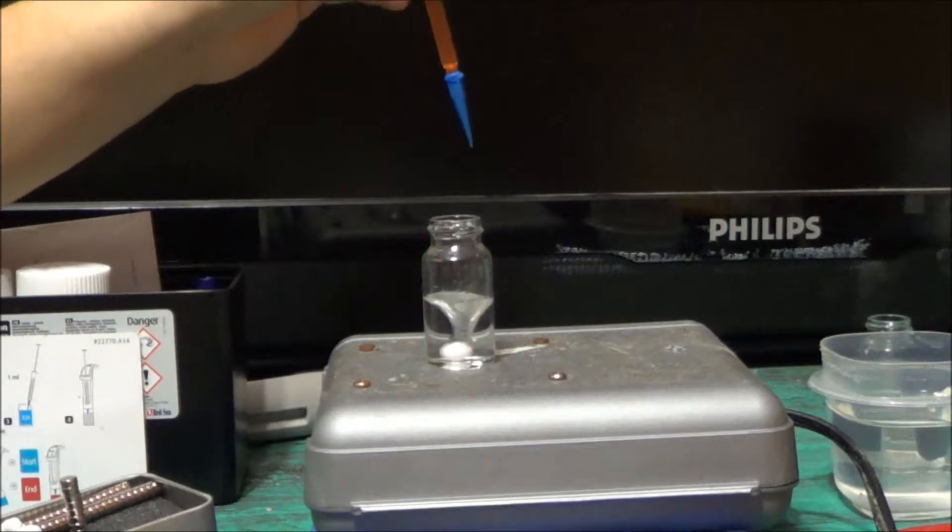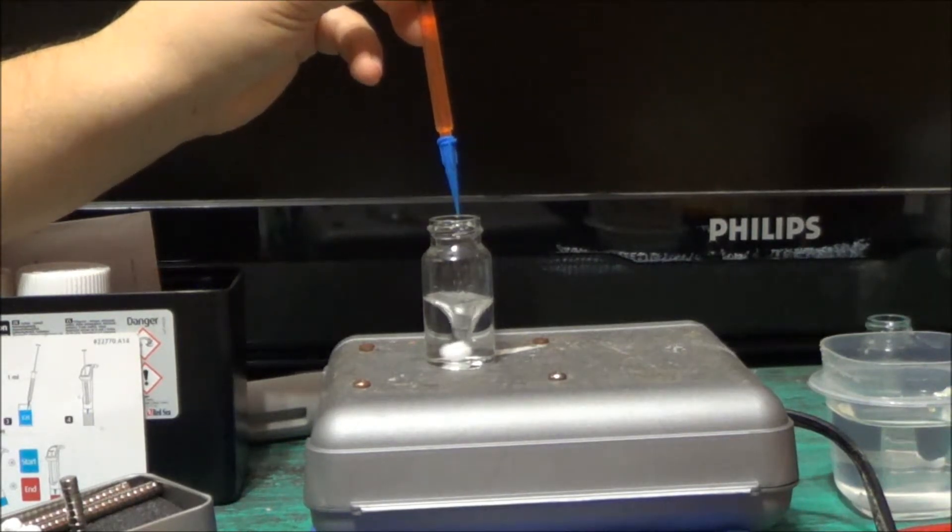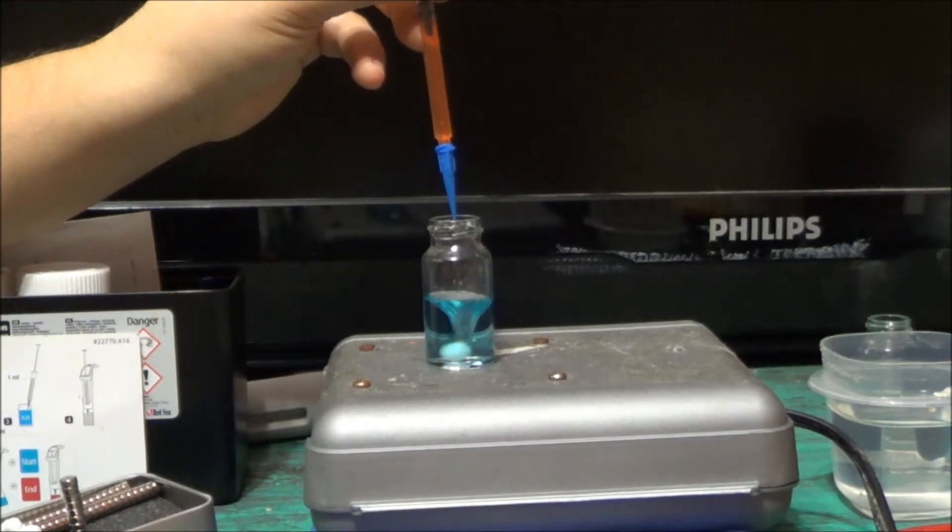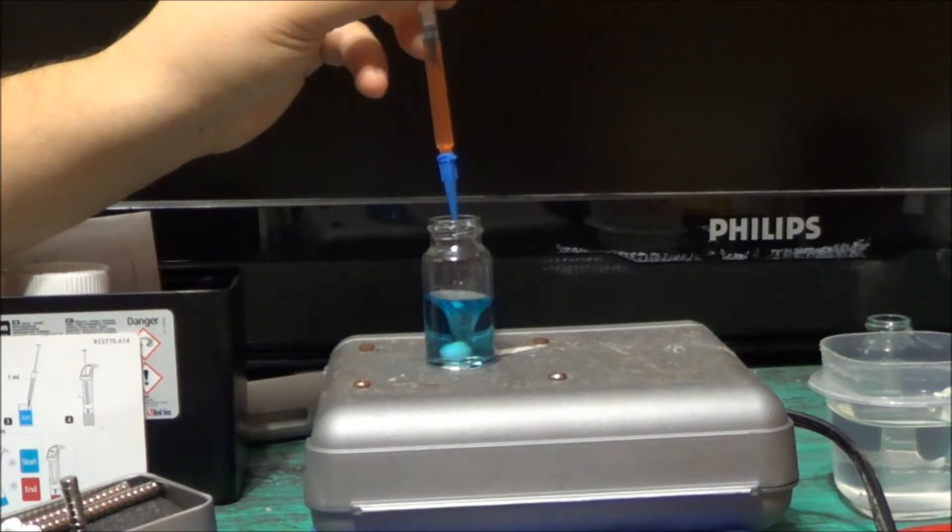And we're kind of wanting that orangish color to turn. First it's going to be blue. And notice I'm not having to worry about shaking every time I'm putting a drop in. I'm just worrying about putting a drop and it mixes for me automatically.